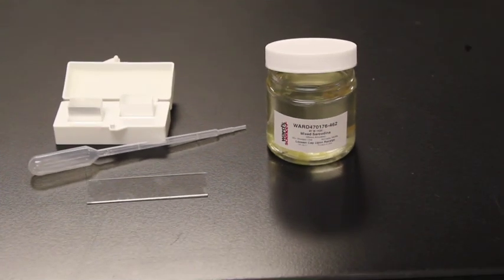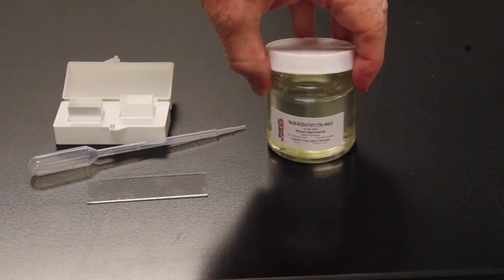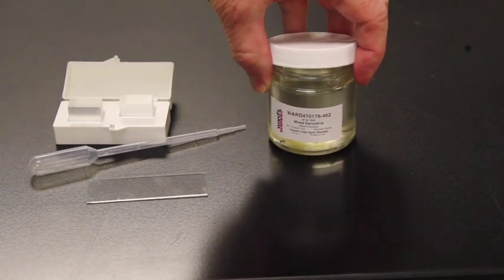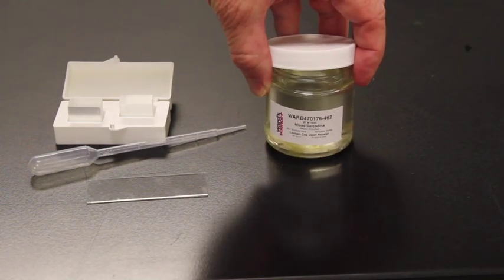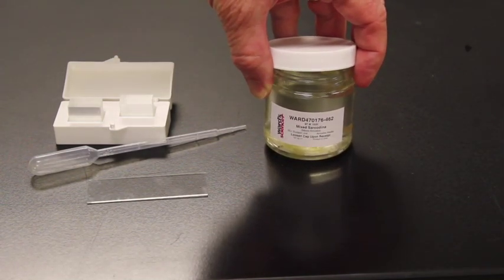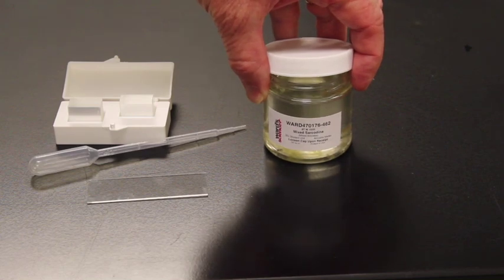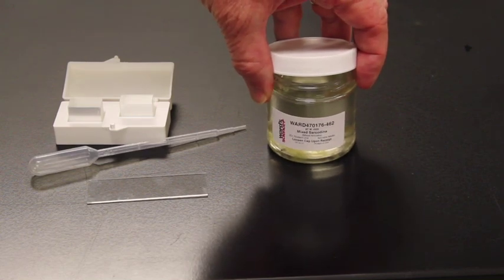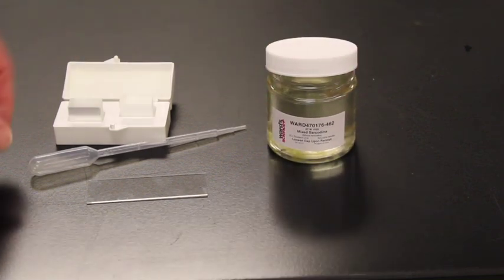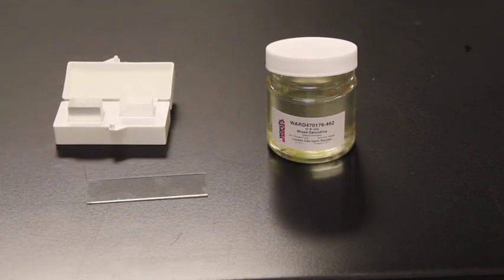To get an example of tubulinids, we have a culture here of living cells. You'll notice that the name is sarcodina, which is an old name that includes both rhizarians and tubulinids, because in the past, since they had pseudopodia, they were put together.